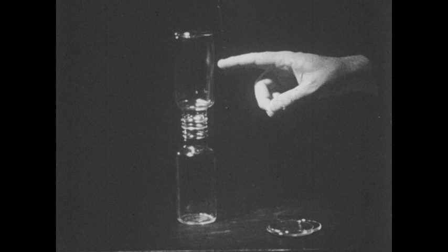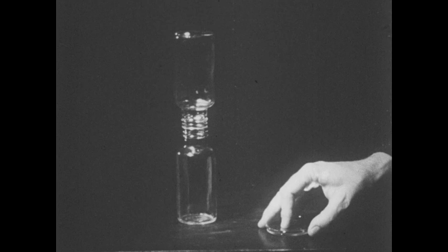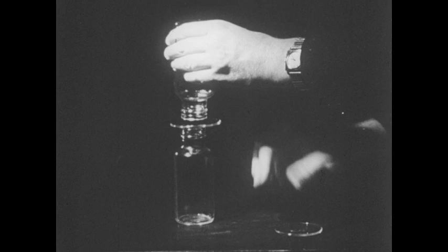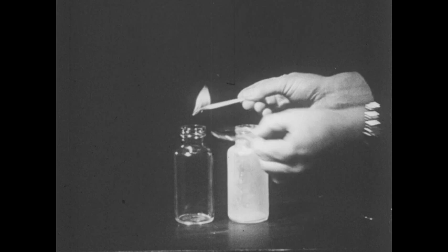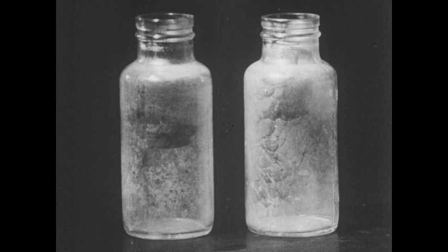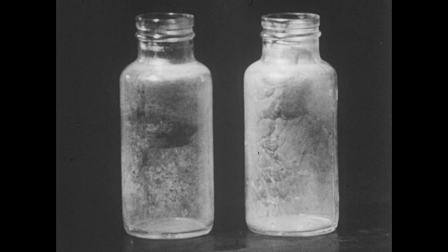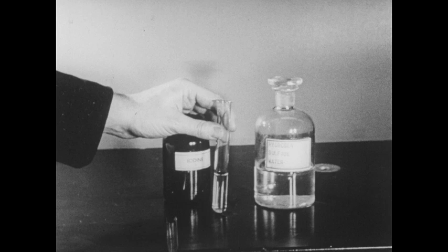One of the bottles of hydrogen sulfide gas collected from our generator has been placed mouth to mouth with a bottle of oxygen gas. The two bottles have been allowed to remain in this position for several minutes. We'll now test the reaction of hydrogen sulfide with oxygen by removing the top bottle and attempting to ignite the mixture in both bottles. The hydrogen sulfide-oxygen mixture burned with a flash of blue flame, and the bottles are now coated with a thin film of sulfur.